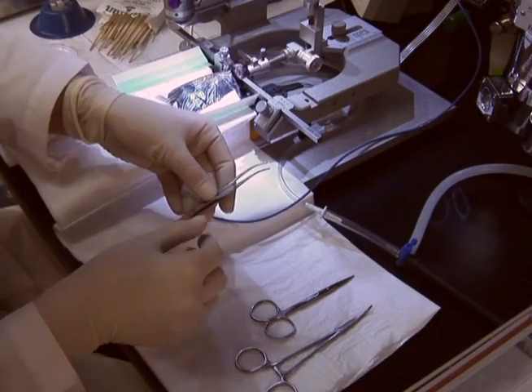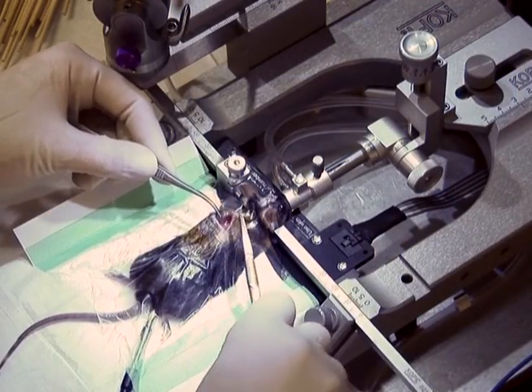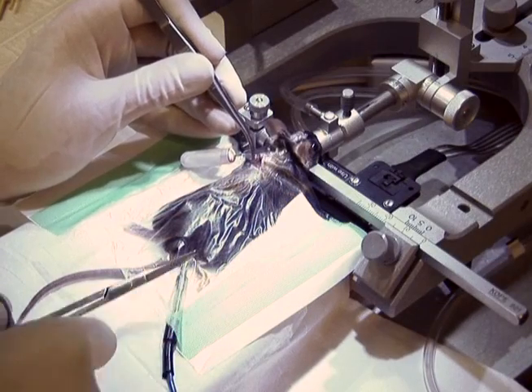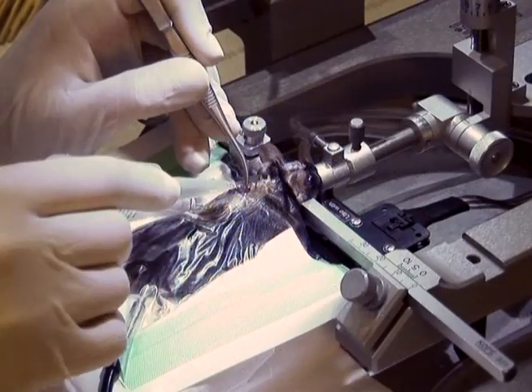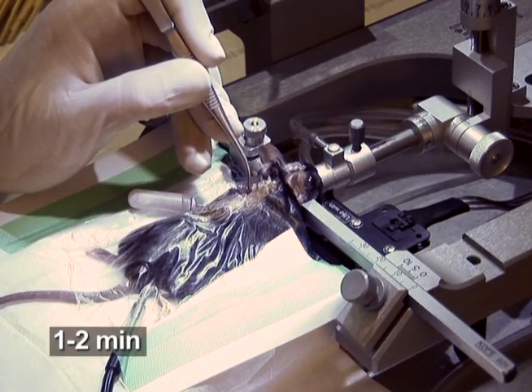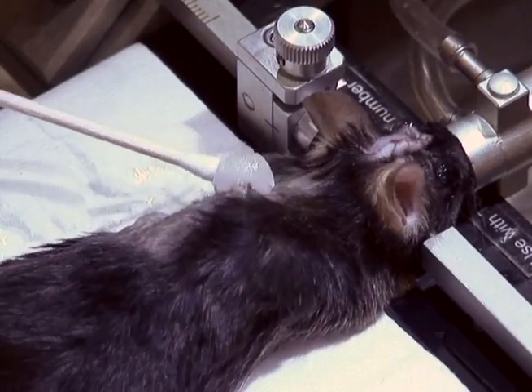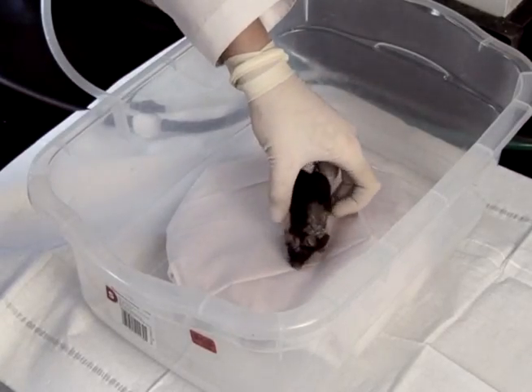To remove a spent pump, carefully pull the pump out of a 1.5 cm incision made perpendicular to the pump junction on the back of the mouse without significantly pulling or pushing on the tubing. Next, clip the tubing approximately 0.5 cm above the flow modulator and touch superglue to the tubing to seal it shut. Wait 1-2 minutes for the glue to dry. Place the tubing back into the incision and suture the incision closed. Dab antibiotic ointment onto the sutured skin and place the mouse on a heated recovery pad.